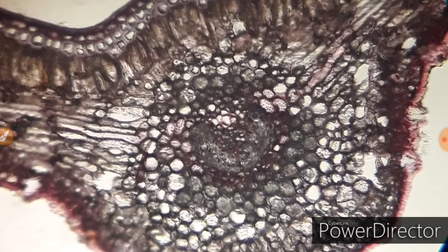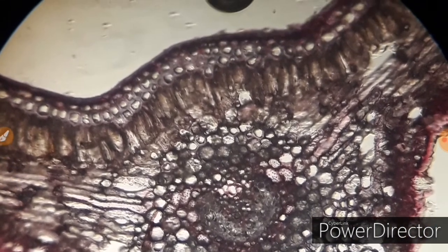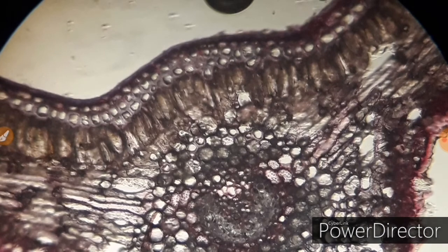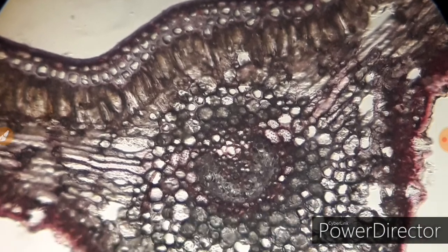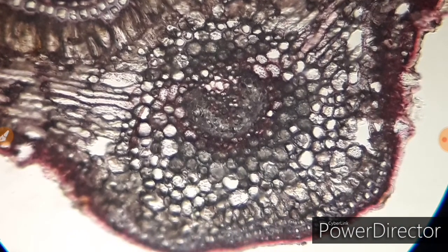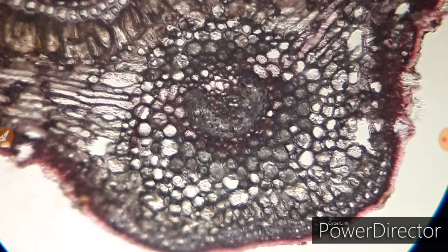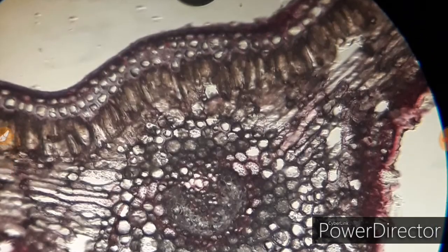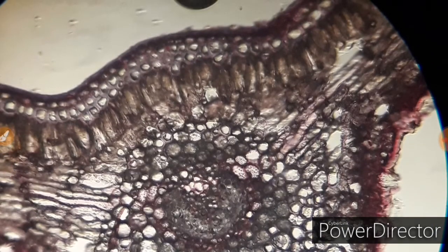Let me zoom in for you. As you can see clearly, the sclerenchymatous cells, the palisade cells, the vascular bundle in the center, and the accessory transfusion tissues.